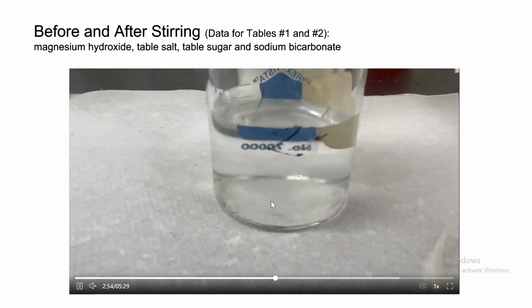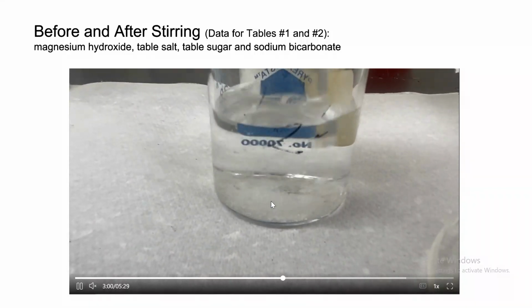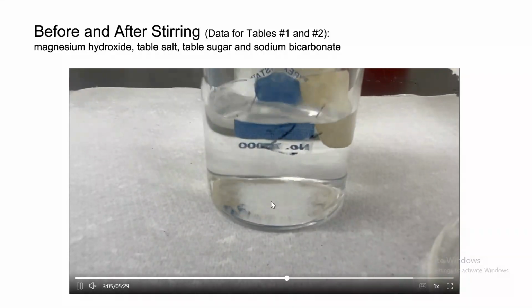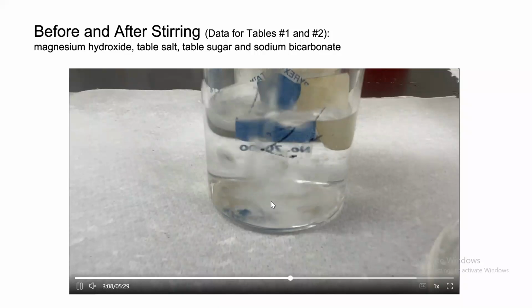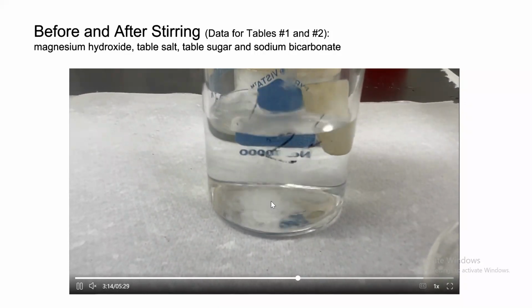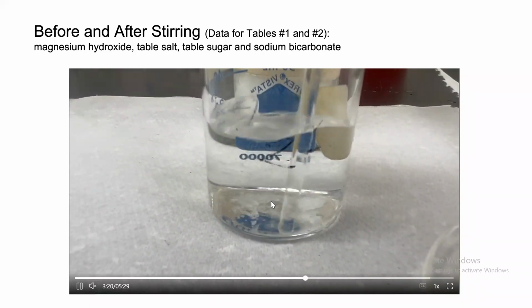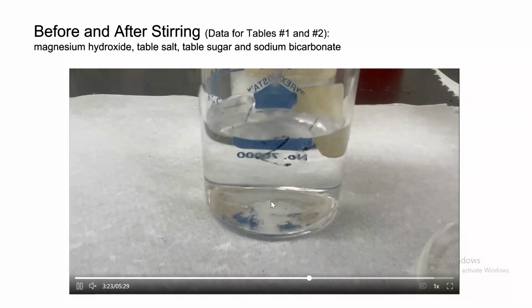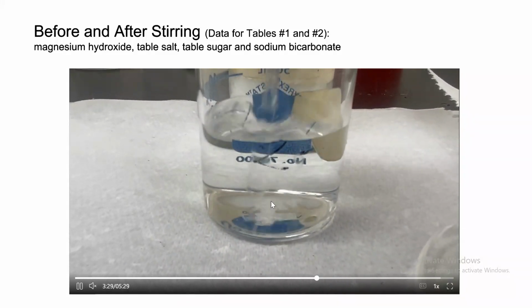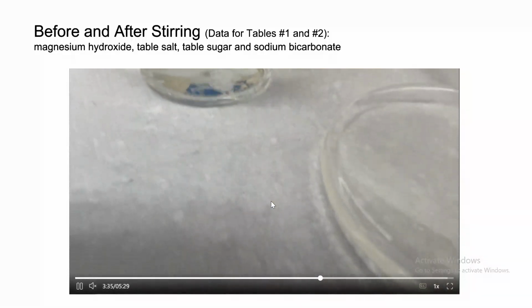And we're stirring the sugar water mixture now. So the goal is to find here: does sugar dissolve in water or does it not dissolve in water? We should know this from our experience. When you put sugar in water, it does dissolve. Just give it a little bit of time. Again, dissolving is temperature dependent. If the lab is a little cold, the sugar will not dissolve completely. But if you keep looking, the sugar is dissolving. So we're gonna say sucrose dissolves in water and it's soluble.